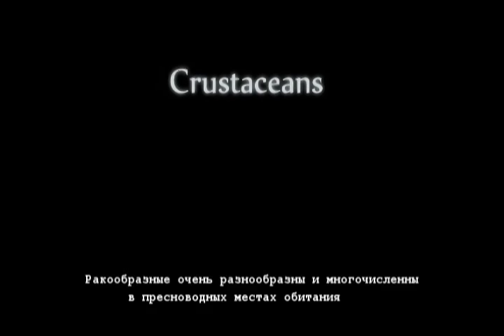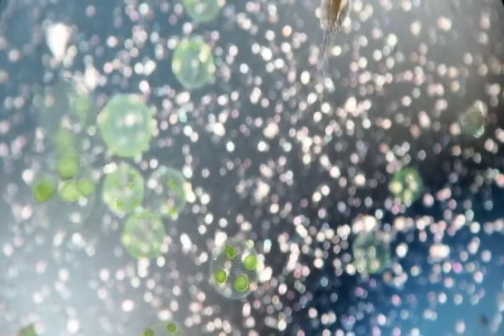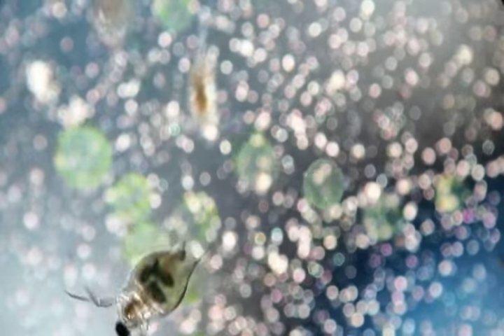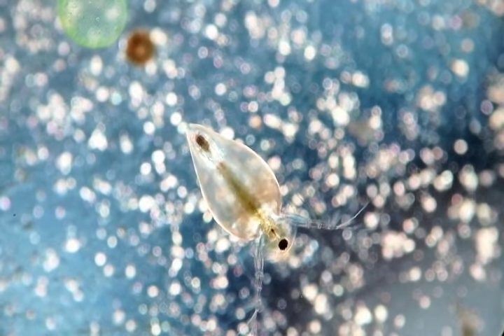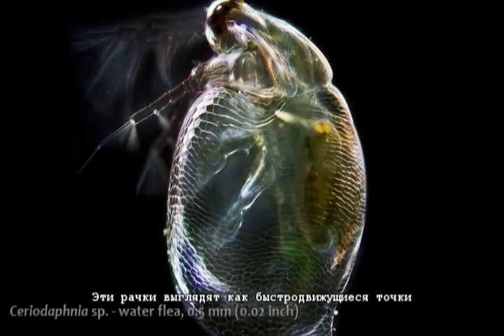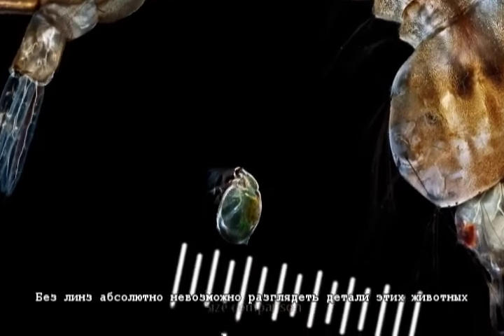Crustaceans are very diverse and abundant in freshwater environments. The smallest groups include water fleas. Water fleas appear like small, fast-moving dots. Without lenses, it's impossible to make out any details of these animals.